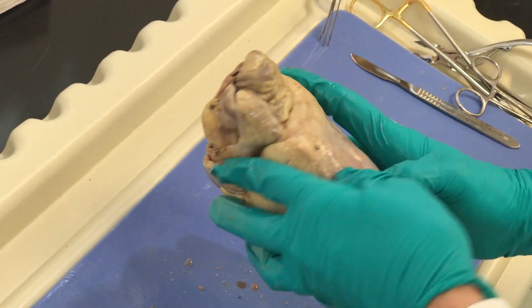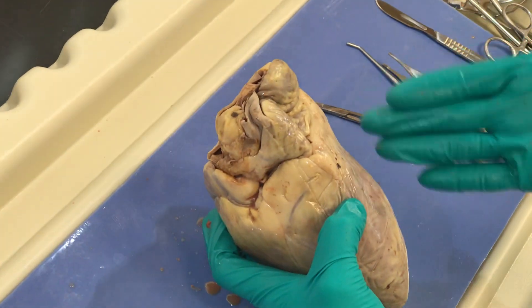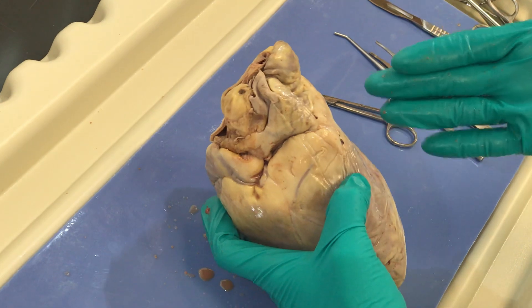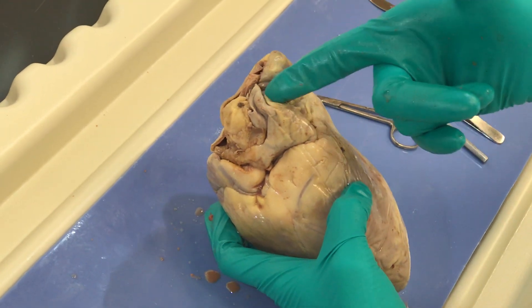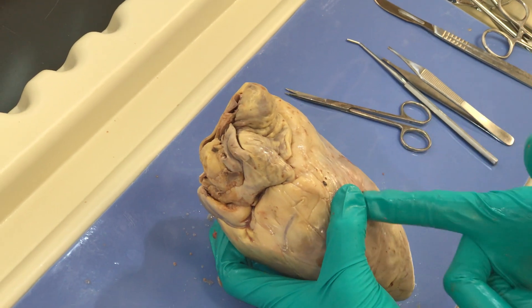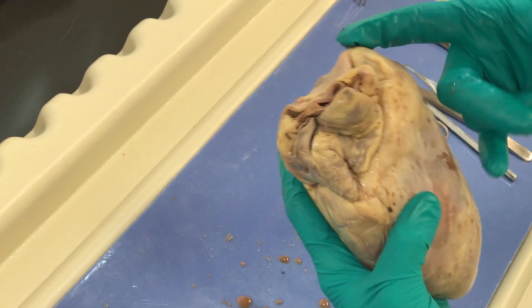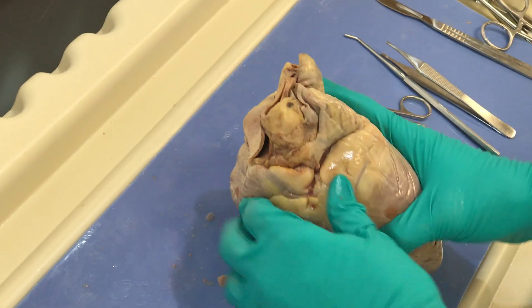I'm going to do a 90-degree turn because when I make my cut, I'm going to cut through the flow the way the blood flows throughout the heart. I'm going to start in my right atrium, go to my right ventricle, and then make an incision up and out the pulmonic trunk. It's really important to be able to follow that pathway of blood flow.